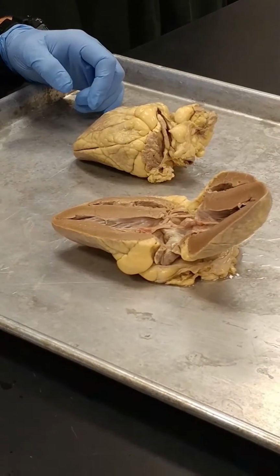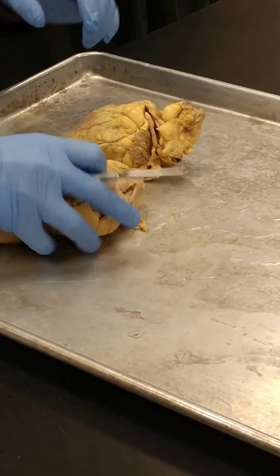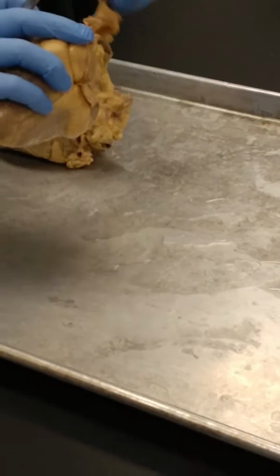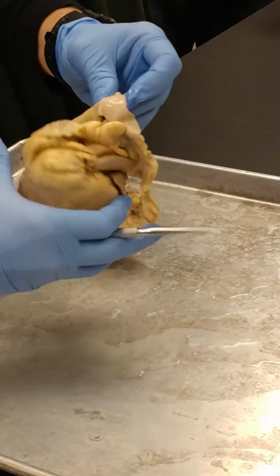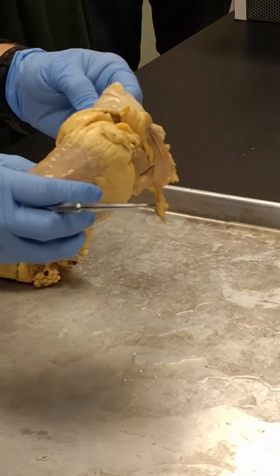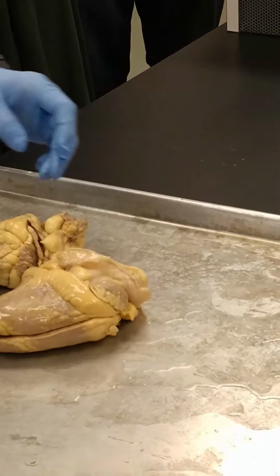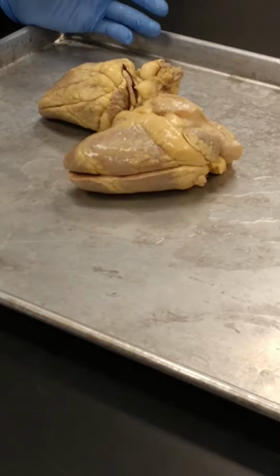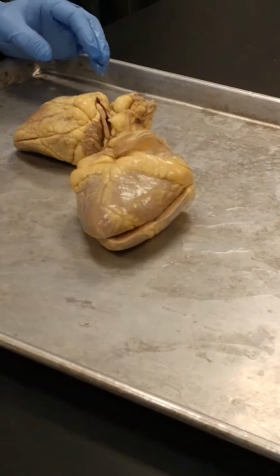So next thing, pericardium, pericardial sac. We don't have any of the pericardial sac left over. Actually, there is some right here. See it right here? That's pericardial sac. See how tough and fibrous that is? It's thicker than you might think. Remember I said before, it's got a pericardium to it, but it's also got that outer fibrous layer. That's non-expansile. It doesn't expand. Okay, next thing.